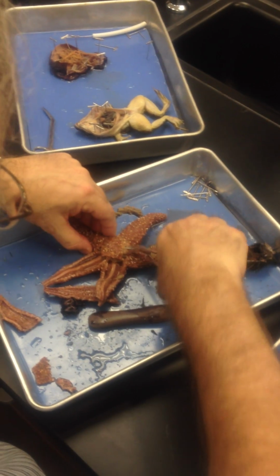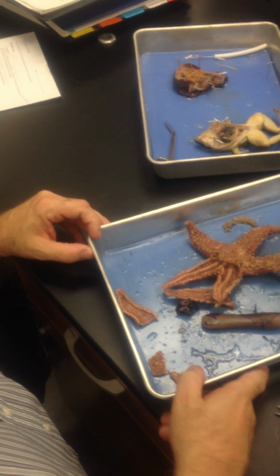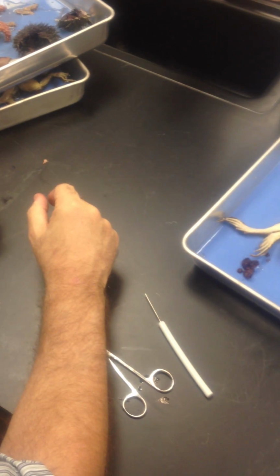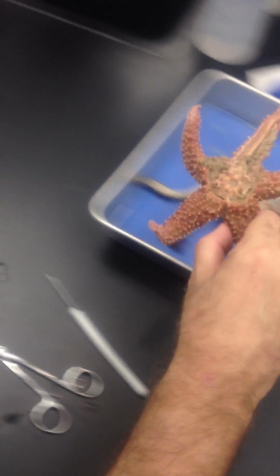Oh, I know. Mine's open. You've got one open? Yeah. Go for it. He's bringing it. It'll save us some time. Ah, how sweet it is. Nice.